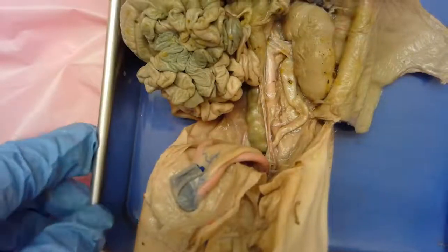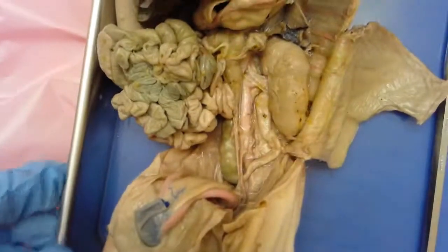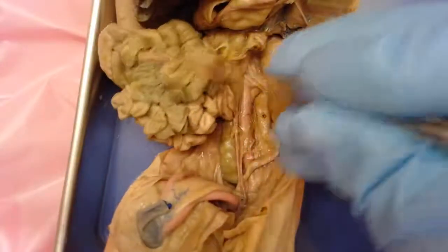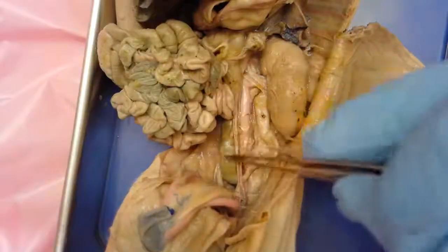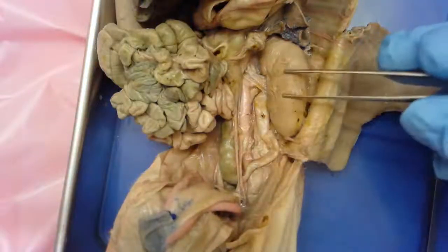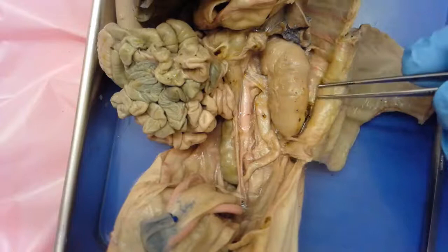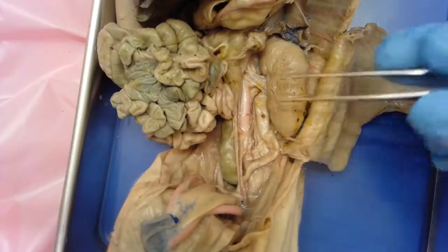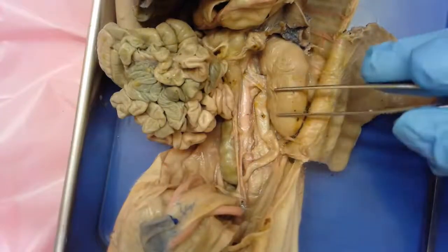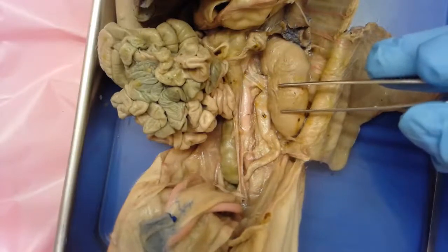Today we are talking about the urinary system, and we're in the abdominal cavity. There are the intestines here, you can still see the rectum exposed, and this structure here is the kidney. The kidney is exposed and it's easy to tell that's what it is. The kidneys in the pig and other mammals are actually what we call retroperitoneal.